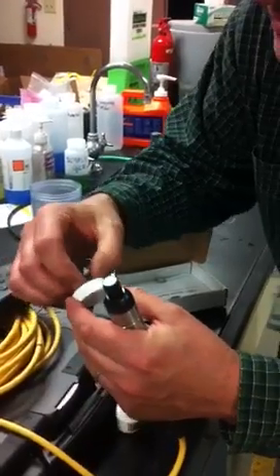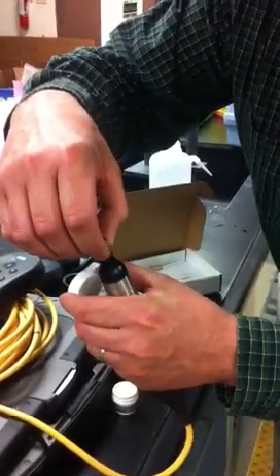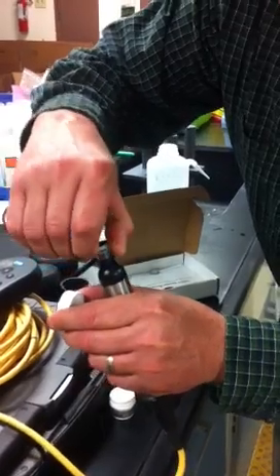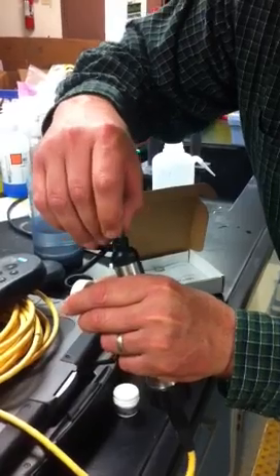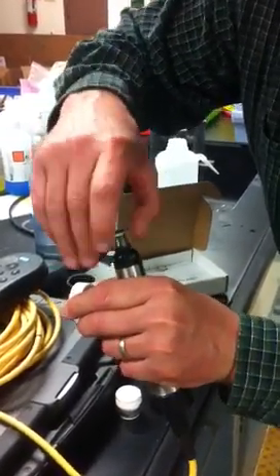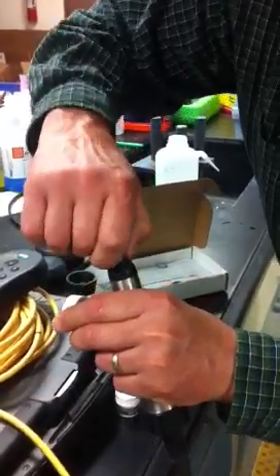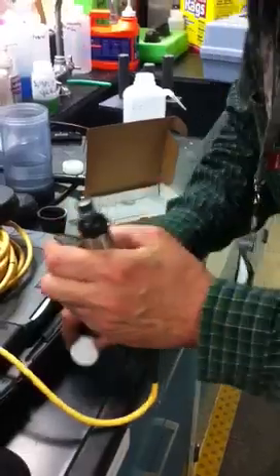So without touching anything, on the top you touch the side edges, and then you use the new cap to push the new seal on. And once it hits the threads, it should go pretty easy. And that's it. Finger tight. Make sure everything's sealed up and you're ready.